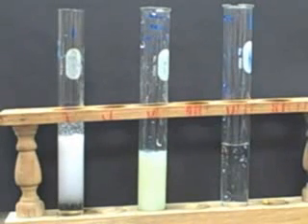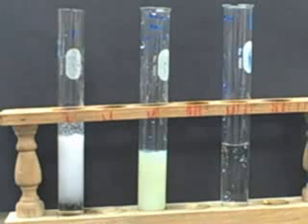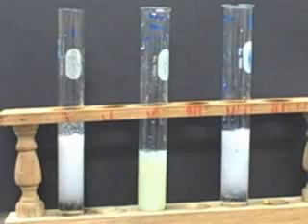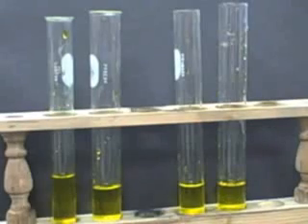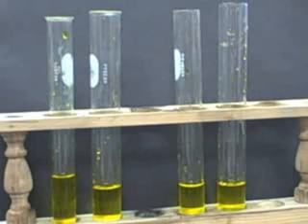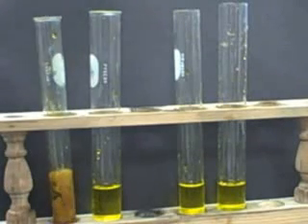And then this is lead nitrate and sodium chloride. Also a milky white precipitate, a little more bluish if you look closely. So those are halides. So now we're going to do some chromates. I actually have no idea how this is going to turn out. We've got our beautiful yellow color of potassium chromate there, and now we're going to add copper sulfate to the first test tube.